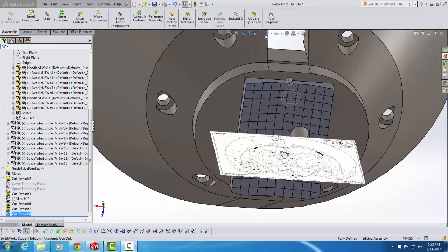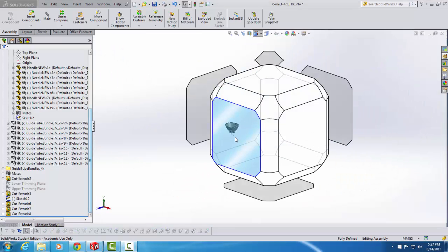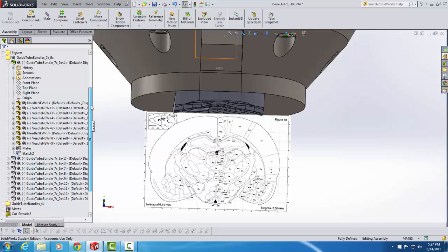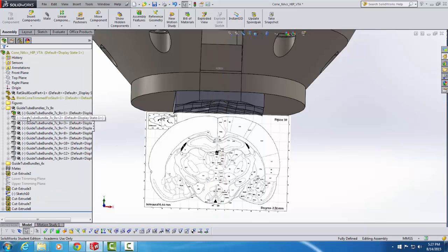And I'll start that by going up here to the View Orientation button, going back to my standard view. And since you've seen all this before, I'm going to go a little bit faster this time. I'll start by going over here, and I'm going to collapse this guide tube bundle that I've already created. And notice that even though the guide tube bundle is colored, suggesting that it should be visible, it's not. And that's because when we carved the hole, it carved that guide tube bundle right out of the picture. So we can't see it anymore.